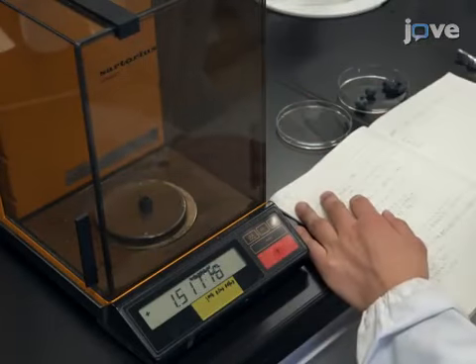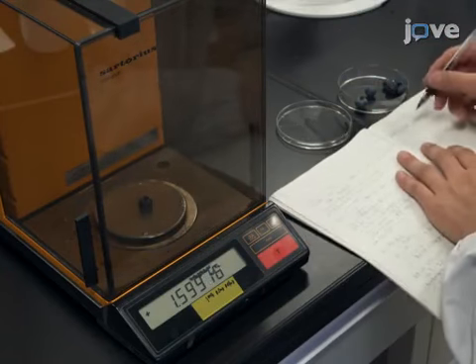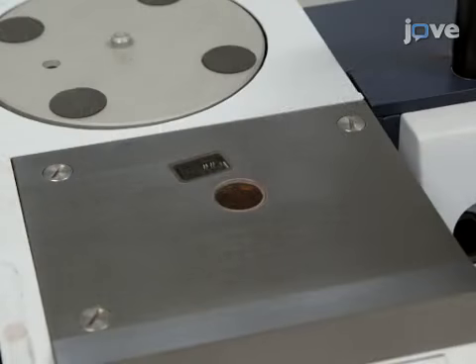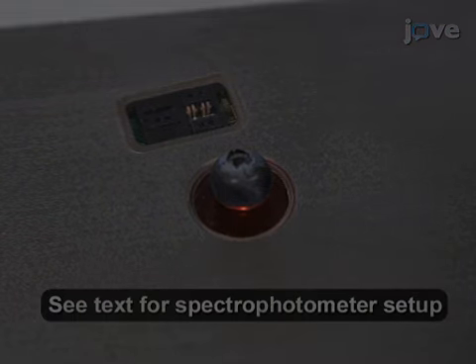The weights measured are used later for the calculation of content % of ingredients of each blueberry. Next, put a blueberry sample in the center of the window of the near-infrared spectrophotometer for diffuse reflectance.